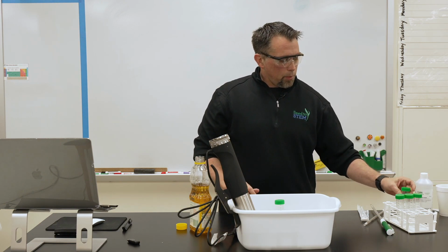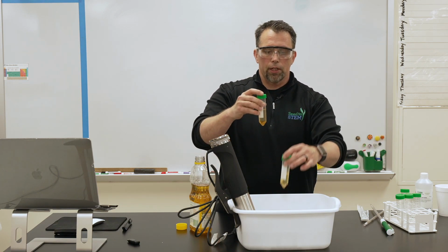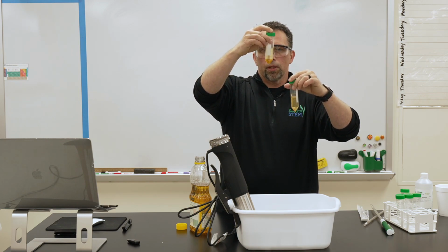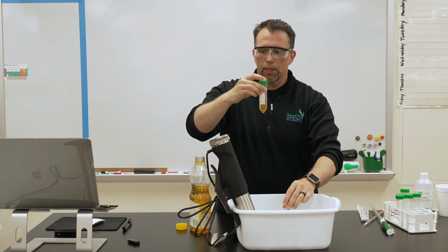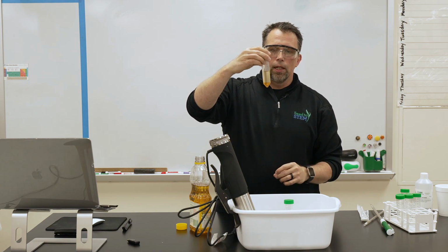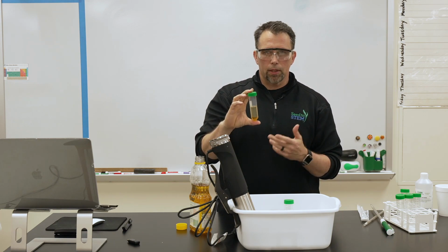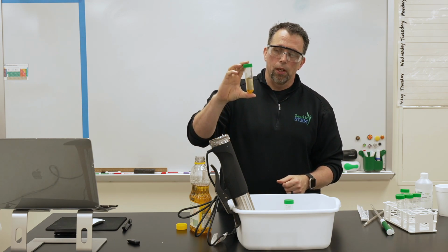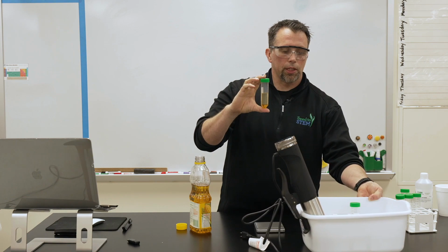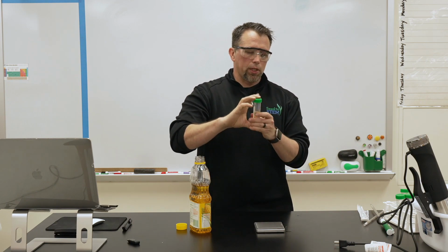Okay. When you come in the next day, you'll see that this is inverted. Instead of having the clear methanol layer at the top, you'll have this darker layer at the bottom, about 5 milliliters again. And that's the glycerol that's been taken off. And then above that is the fatty acid methyl ester, or the biodiesel. If you wanted to run that through an engine, you'd want to wash it several times. Again, for this lab and the workshop, we have to turn this around pretty fast, so we don't go through the washing steps that you would need to do to actually use that in your diesel engine. So that's what it takes to prepare that.